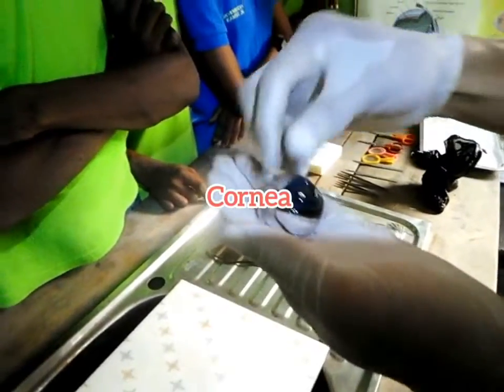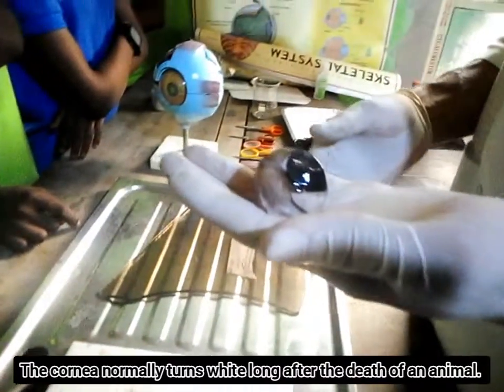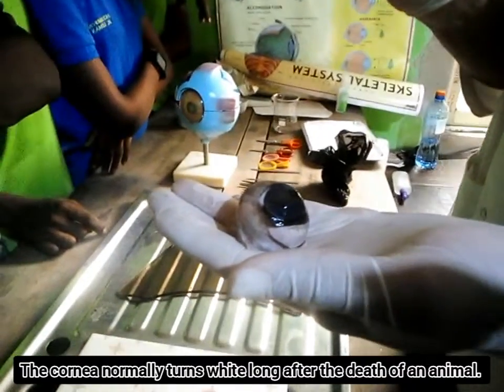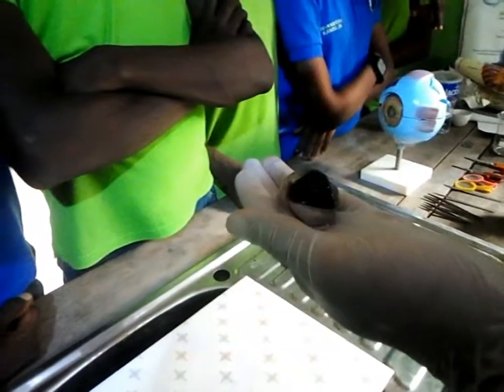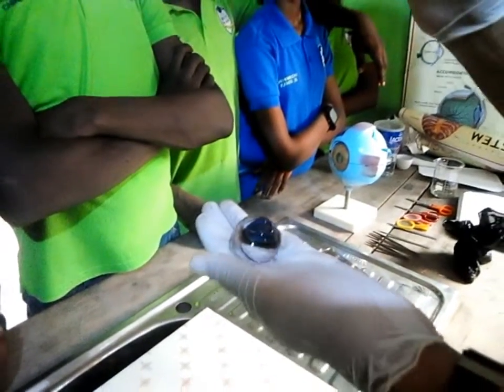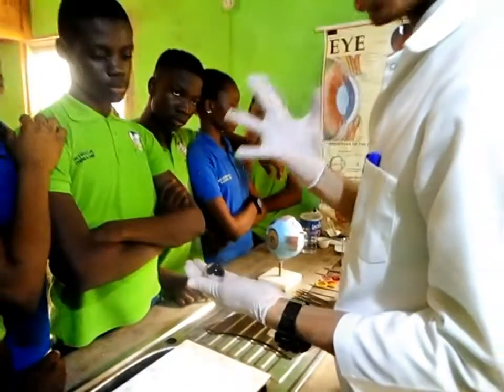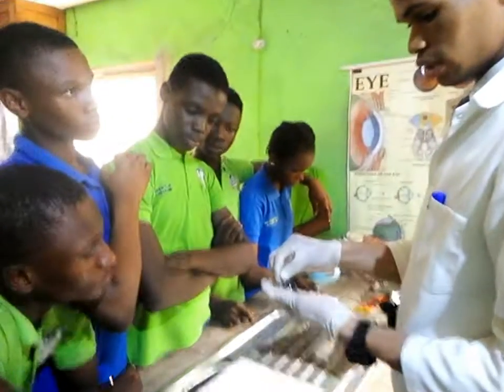I talked about the cornea before. Do you get that? Now whenever an animal dies, are you getting me? The cornea is normally translucent. That means it's transparent, like your own cornea that you have now. Are you getting me? It's kind of transparent. You understand? But when the animal dies, it becomes white. Are you getting me? You understand? It becomes thick and white. So that's why it's this way.